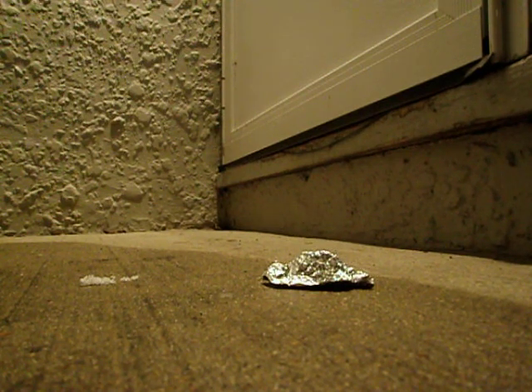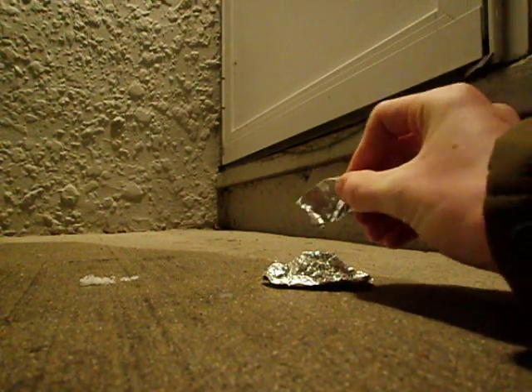So I'm just going to put the lid back on so I don't get anything in, and I guess we'll start the reaction.